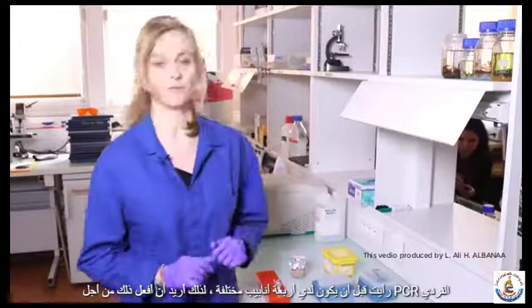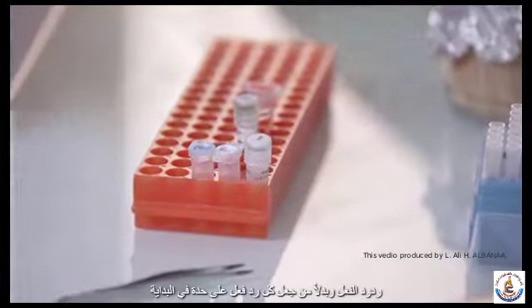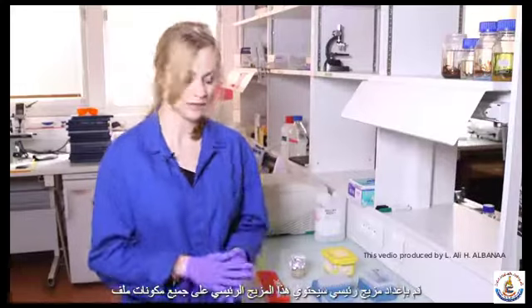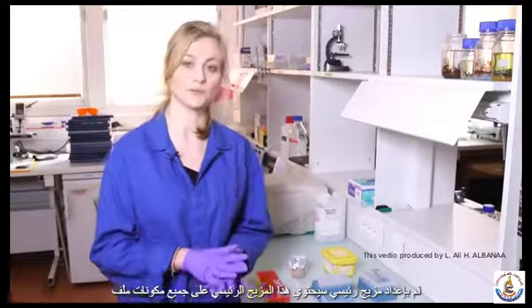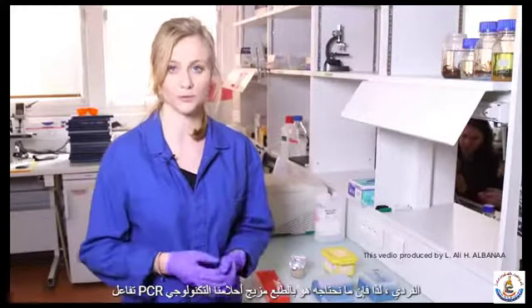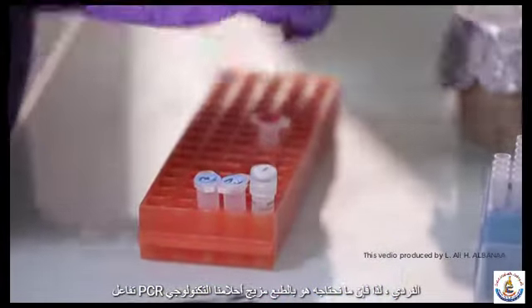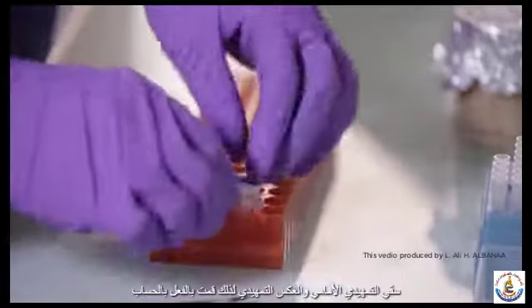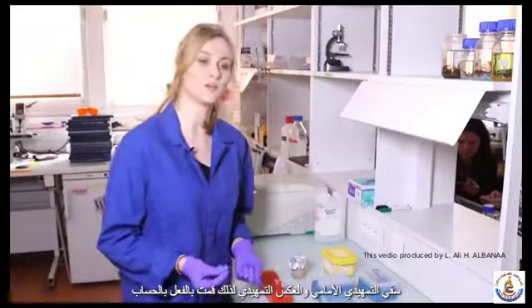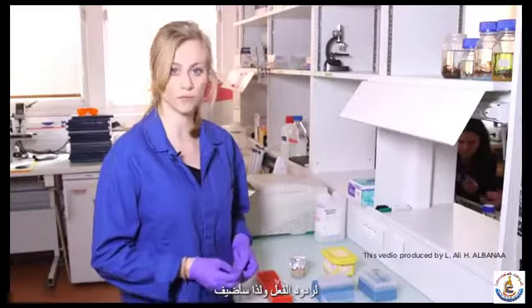As you saw before, I have 4 different tubes, so I want to do 4 individual PCR reactions. And instead of making every reaction separately, I first will prepare a master mix. This master mix will contain all the components for the reaction, and later on I will divide the master mix into 4 tubes for each individual PCR reaction. So what we need is, of course, our DreamTaq mix, some water, a forward primer and a reverse primer. So I already made the calculation to know how much of each component I need to add in order to be sufficient for 4 reactions.